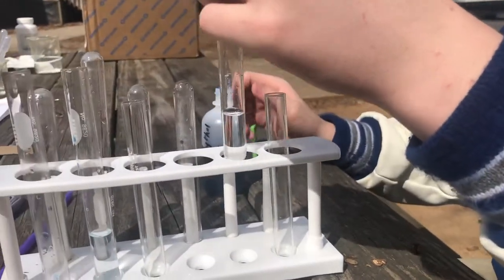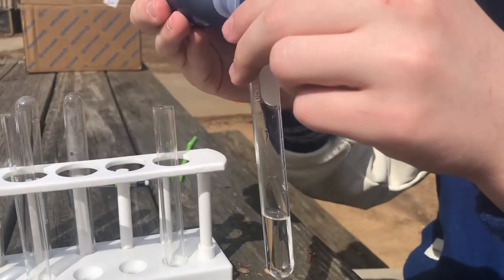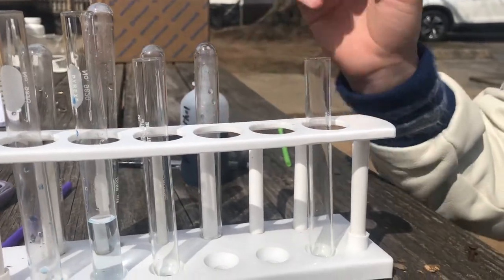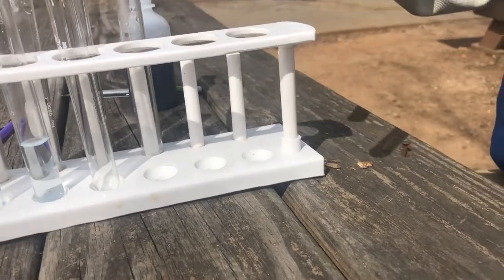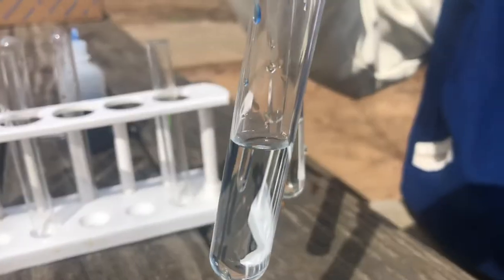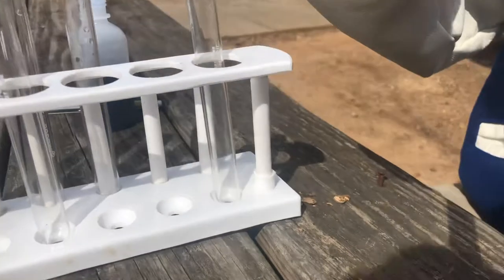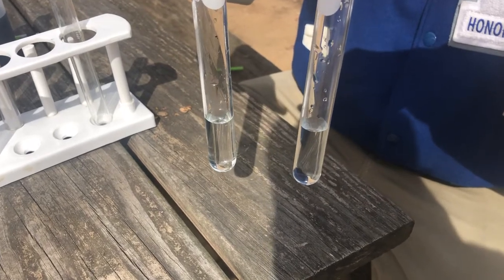Hopefully that has changed our water in some significant way by adding carbon dioxide. He's going to add a drop of bromthymol blue and give it a little swirl. You should be able to see that it is a very pale yellow. The first one was a very pale blue, and the second one is a very pale yellow. That yellow indicates that it has changed to an acid. Normal rain is a little bit acidic — we don't call it acid rain, but it's a little bit acidic because carbon dioxide in the air dissolves in that water, giving normal rain a pH of about 5.5.